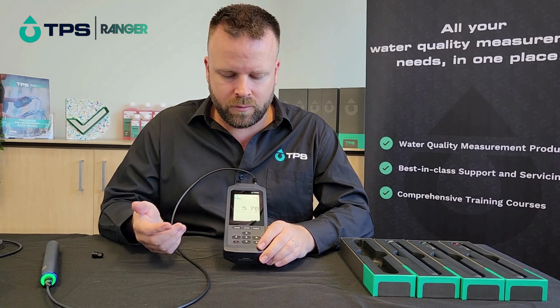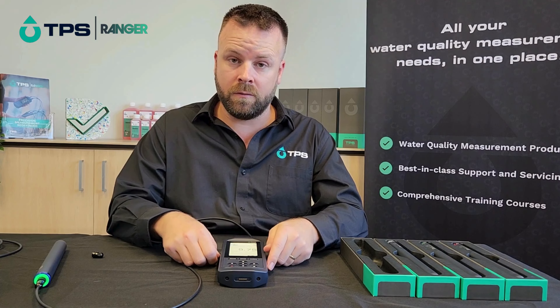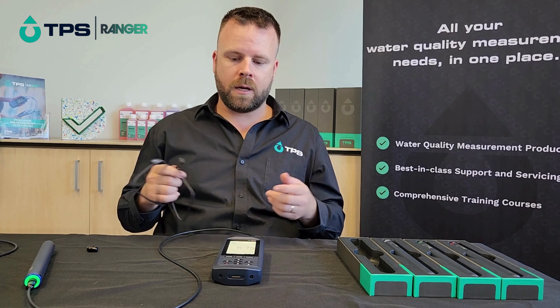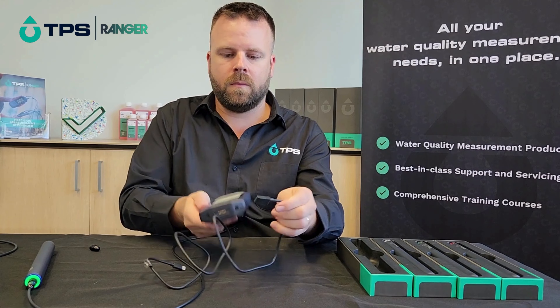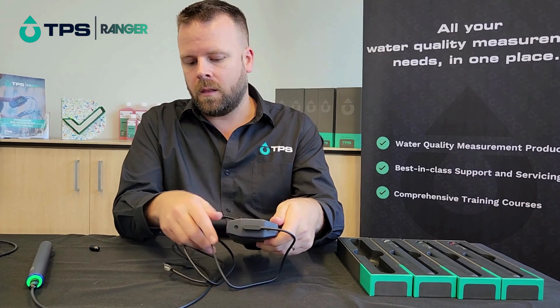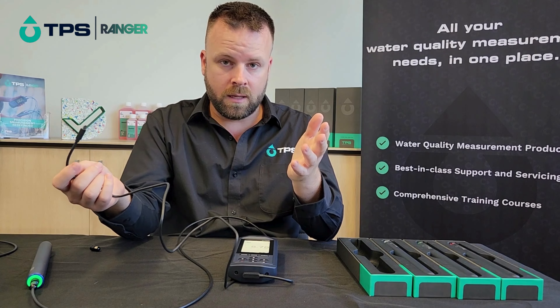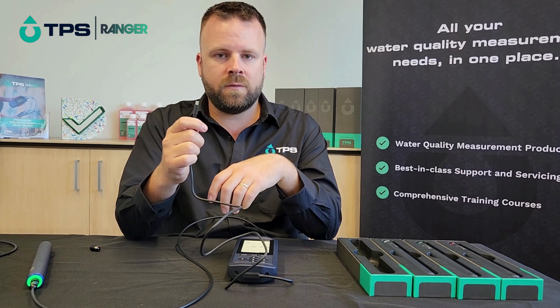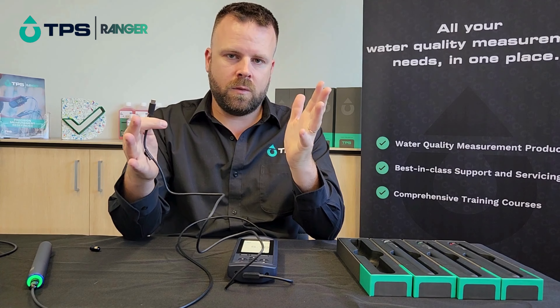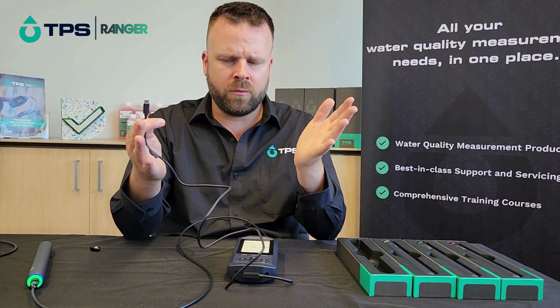Very simple and very straightforward to use — all the sensors plug in the same way with the same cables, and you'll want to do that calibration once you've unpacked it. To charge the unit, we've got this cable which clips on down the end here — that's your charger. It's USB-C so you can plug it into your computer or use the wall plug that came in the kit. That cable is also used for downloading your data — just plug it into your computer, jump into settings, export the data, and it comes out as a CSV file, essentially a spreadsheet with all the data you need.